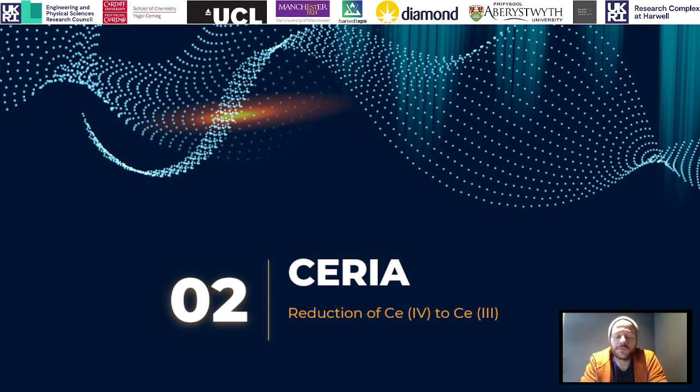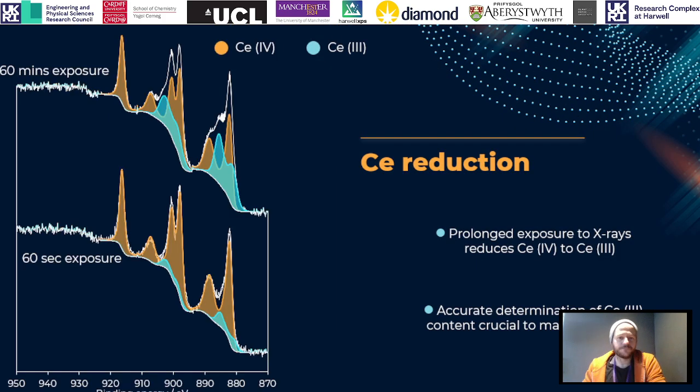So the second example of X-rays damaging or reducing a sample is Ceria. Now Ceria is very commonly looked at by XPS. It's a very useful oxide in catalysis, especially where XPS is widely used, and understanding this amount of Ceria 3+ relative to 4+ is critical to understanding a lot of the processes involved and understanding what makes a good catalyst perform how you'd like. So the quickest and easiest way to visualize what kind of reduction we're seeing here is to look at these two figures here.